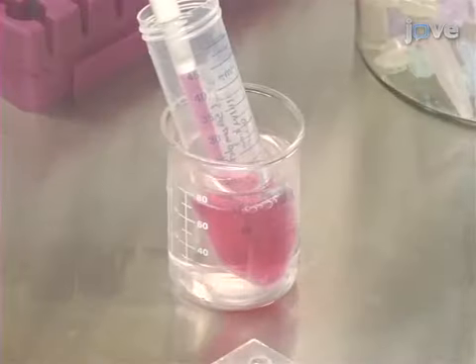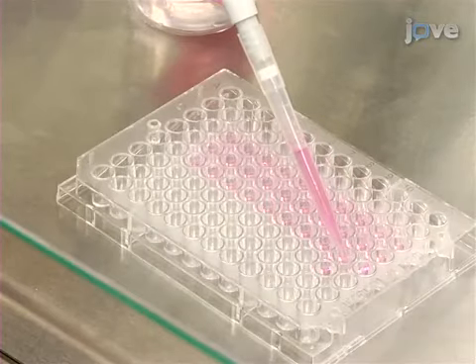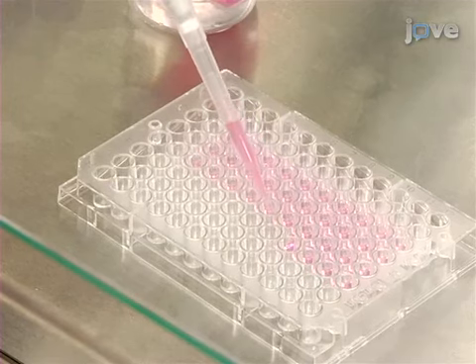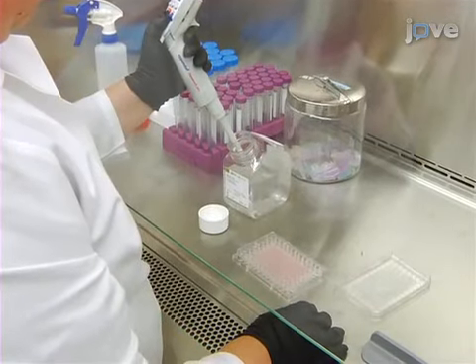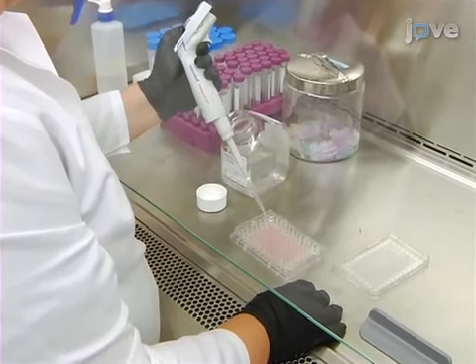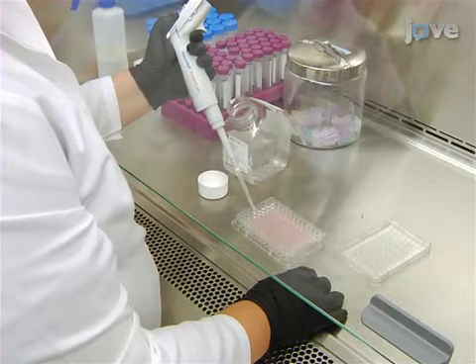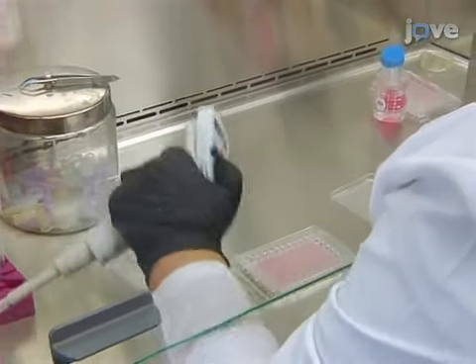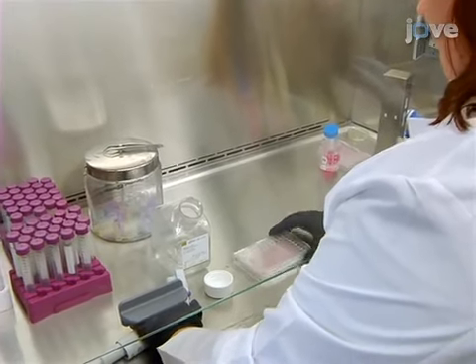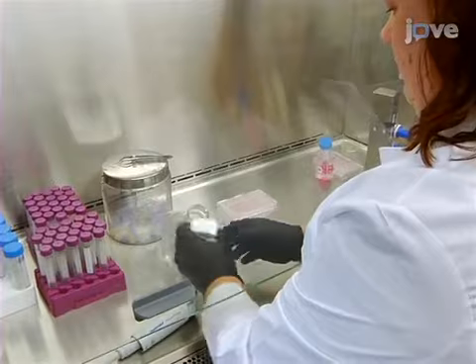Using a multi-pipette, aspirate 50 microliters of the agarose media mixture into the 60 central wells of a flat-bottomed 96-well culture plate. As the wells at the peripheral edges of the plate have slightly higher evaporation rates, add 200 microliters of 1X phosphate buffered saline instead of the agarose to these edges. Once the agarose mixture has been added to the inner wells, set the plate aside to cool to approximately 37 degrees Celsius before the addition of the cells.